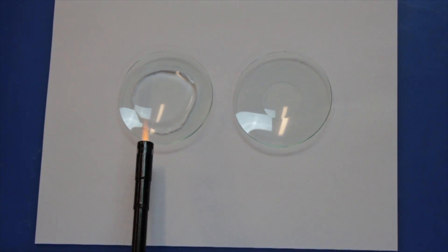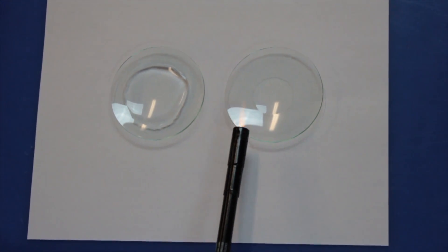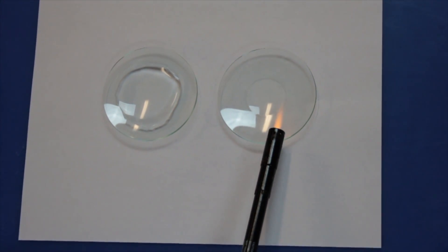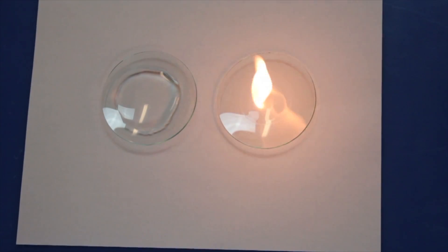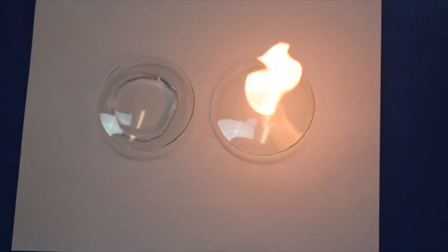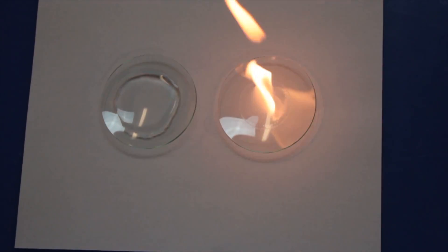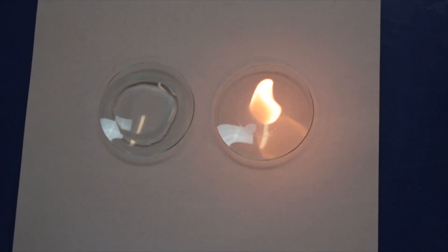If the flame jumps to the sample, the product is flammable, versus if the product needs to be heated up and then catches on fire, it's considered to be combustible, with a flash point roughly of 100 to 200 degrees Fahrenheit.